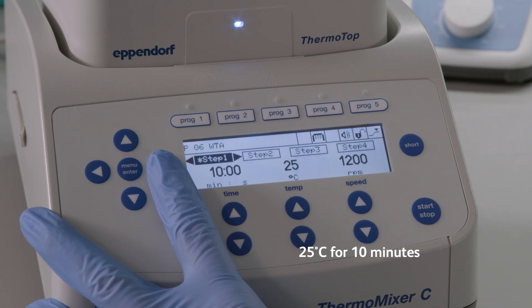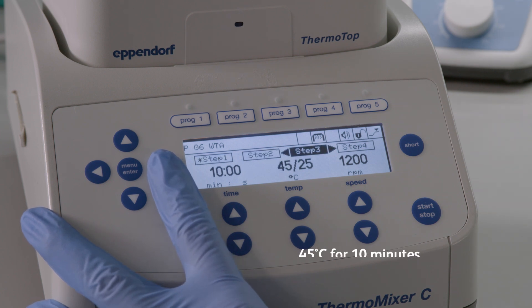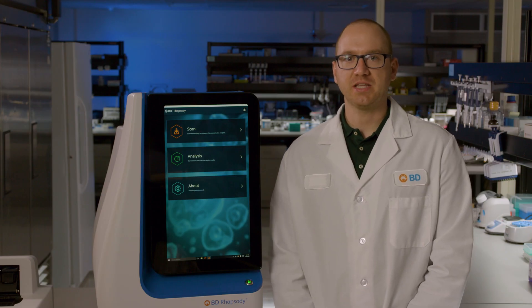The steps are: 25 degrees Celsius for 10 minutes, followed by 37 degrees Celsius for 15 minutes, then 45 degrees Celsius for 10 minutes, and finally 55 degrees Celsius for 10 minutes. This program takes approximately an hour to finish.